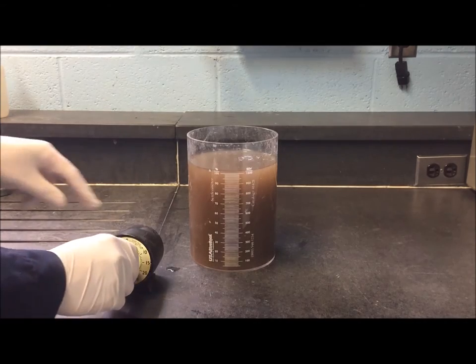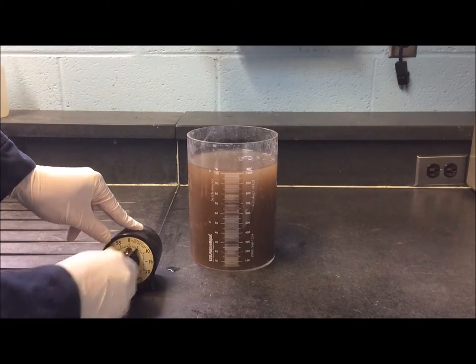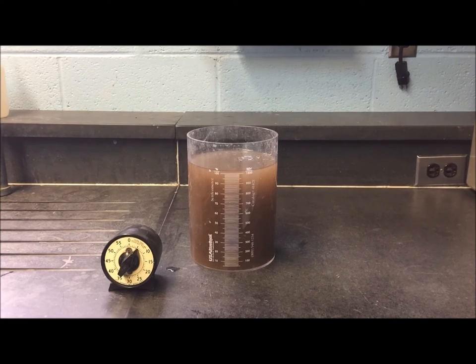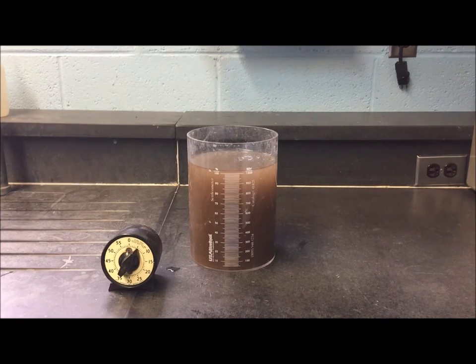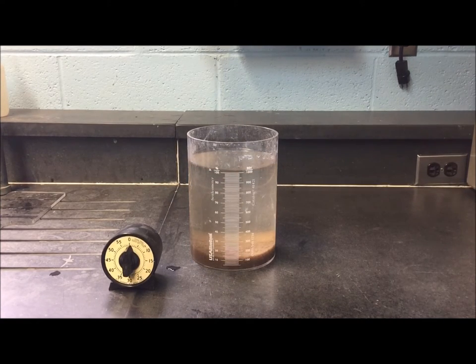We record the sludge settling characteristics at five-minute intervals for 30 minutes. With a little bit of TV magic, here's how it looks like after 30 minutes.